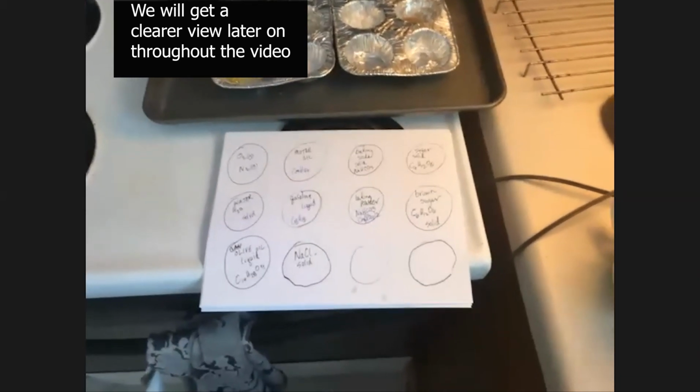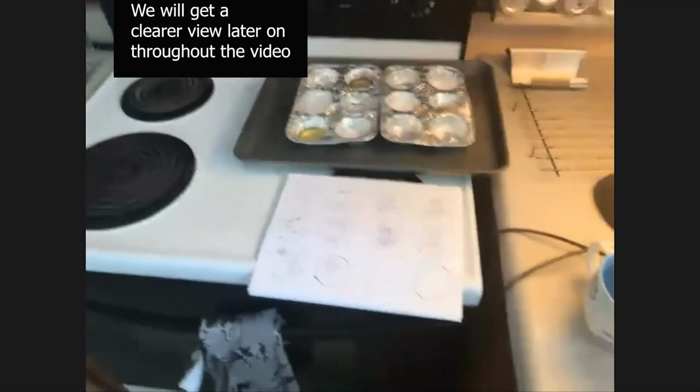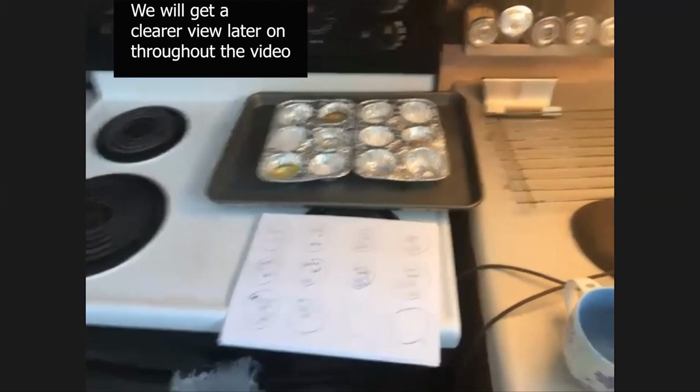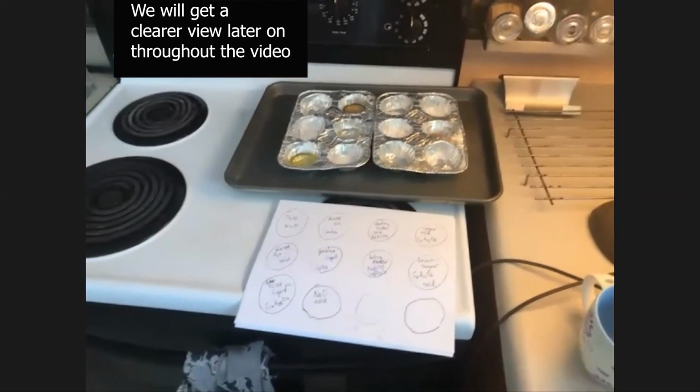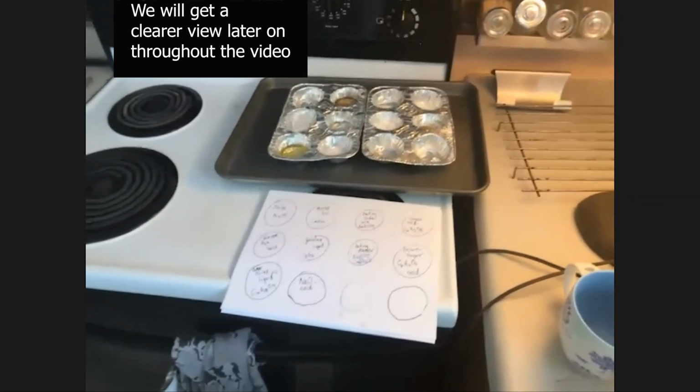Okay, so today there's a couple interesting things. One is it's about 15 degrees Celsius, about 65 or so degrees Fahrenheit here where we're staying, and you can see the states of matter of these various compounds.